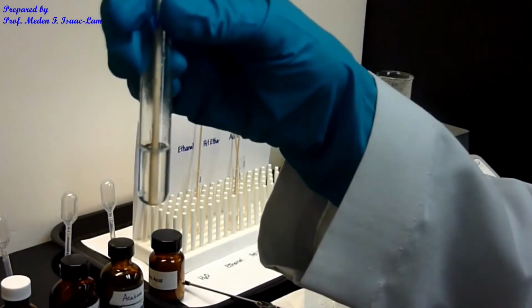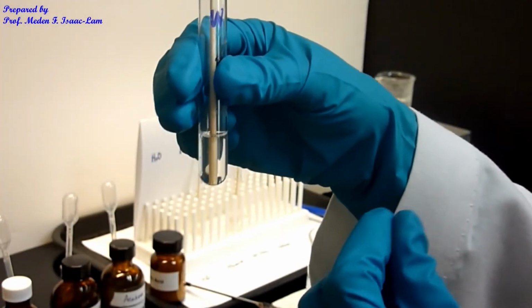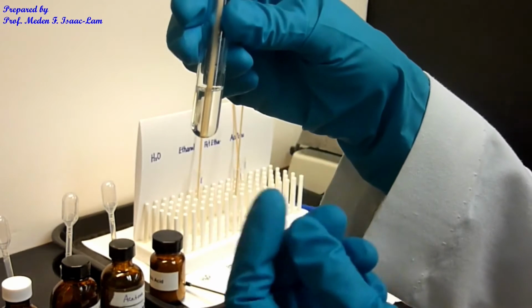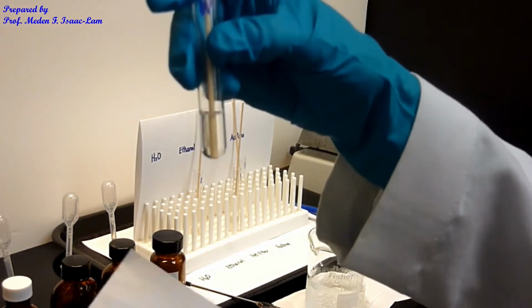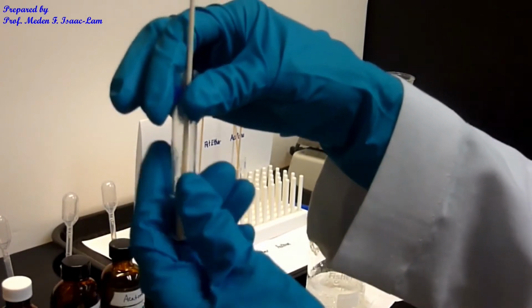So this is now the water sample that I was heating. It took me a while to get it to dissolve. I was crushing and at the same time heating it up. So I finally got it to dissolve after 35 drops of the water. And you can see that I don't have any more crystals at the bottom, so it's entirely dissolved. It's still a little bit warm.